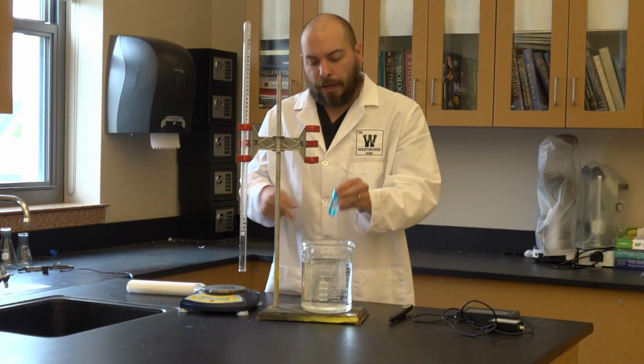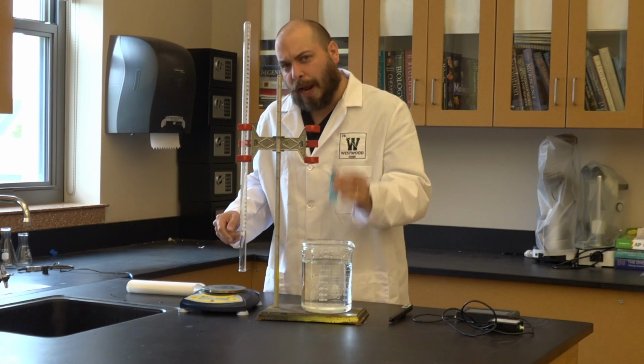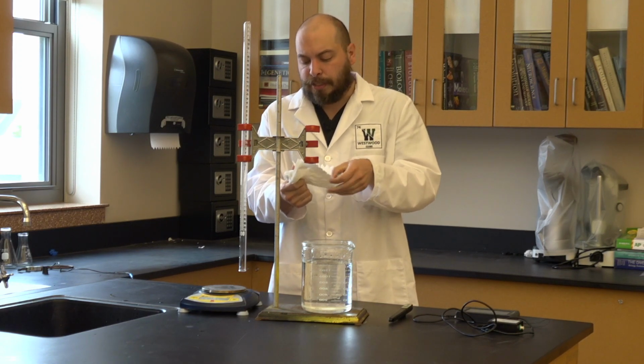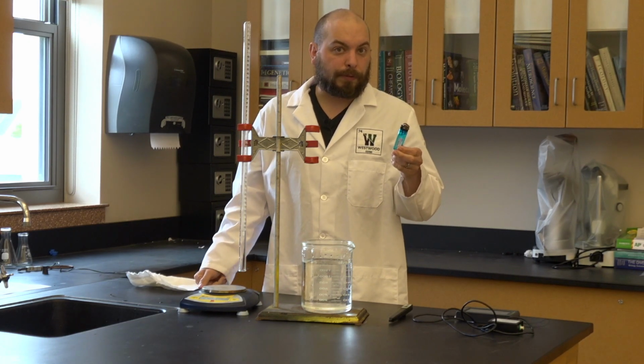We're going to get it a little bit wet, and then I'm going to take it out and shake it off. I'm going to keep in mind how hard I'm shaking and how much I'm shaking. I'm going to dry it off as well, all right? Because here's the thing: is it going to be perfectly dry at this point? No, but we also don't necessarily want it to be perfectly dry.